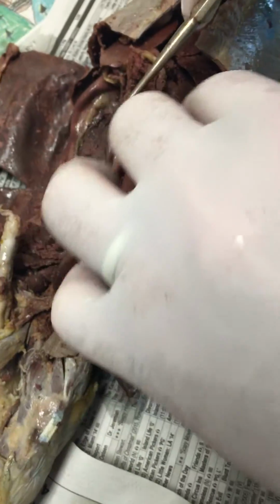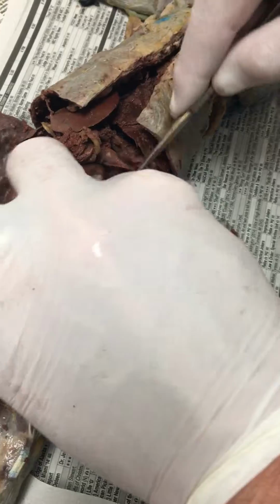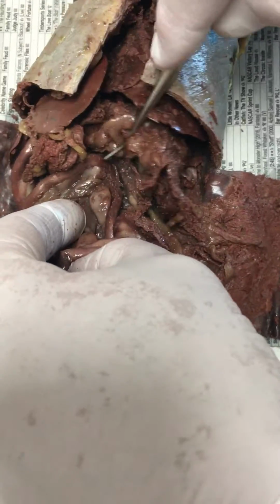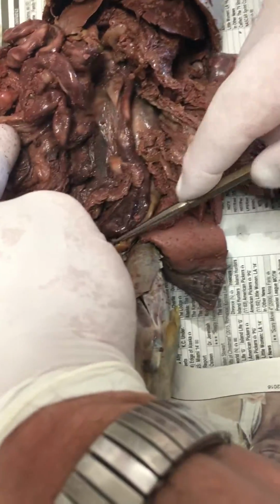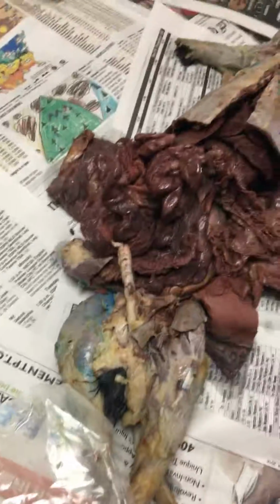The ascending colon and the duodenum, is it the same on the other side? Does it loop around or is it just on one side? Just on one side. Then your ascending colon is here. Transverse colon is the part where it goes across the top. Descending colon is where it goes down the abdomen. And the rectum's all the way down in there. Got those?